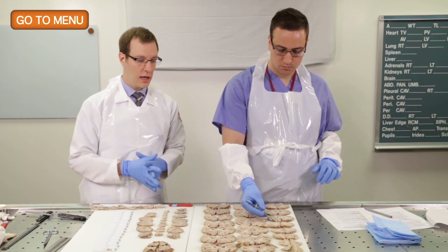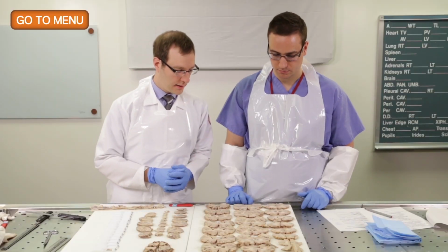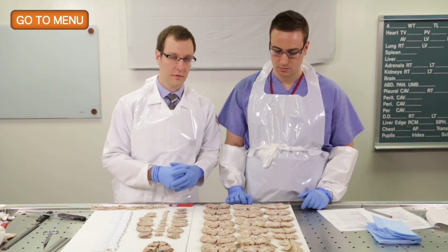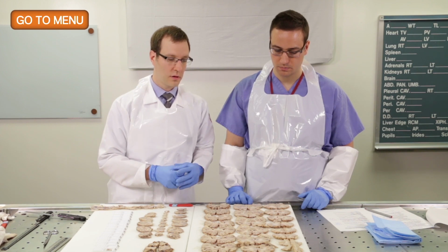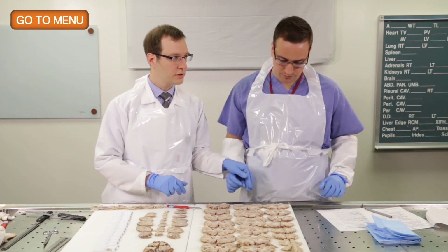Cassette number 2, we sample the basal ganglia, and the area in particular that we target is the area where we will be able to look at the caudate, the putamen, the globus pallidus, and if possible, the nucleus basalis. So one of the landmarks that we would look for to get a good cut, do you know the landmark that we typically look for? Is it the anterior commissure that we look for? That's right, it's the anterior commissure.